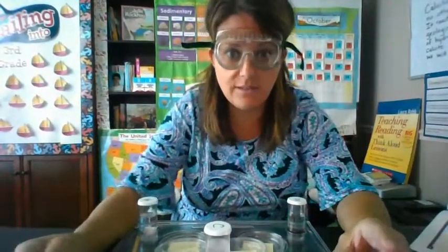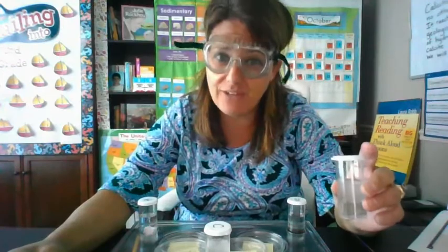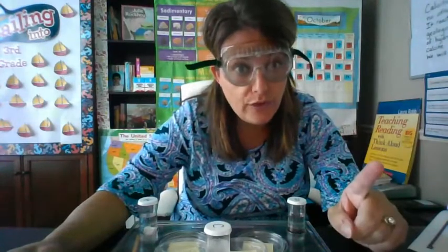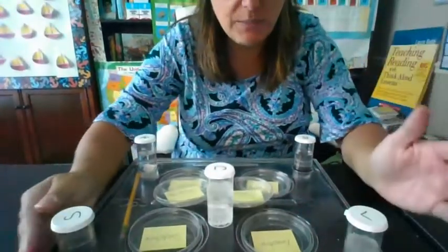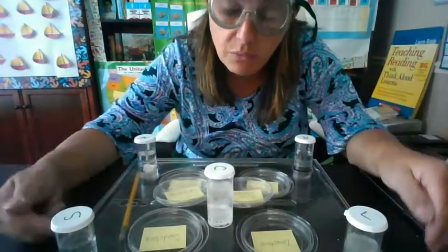I want to say that from a scientific standpoint, just observing this limestone, it's pretty definite that it has calcite in it. But in order for us to prove that calcite is in any of these rock samples, we have to do a special test, which we did before with our mock rocks when we mixed those with water.